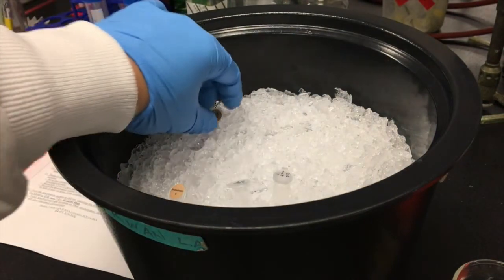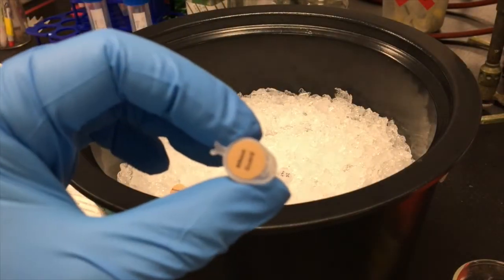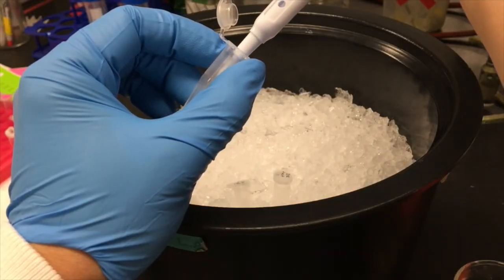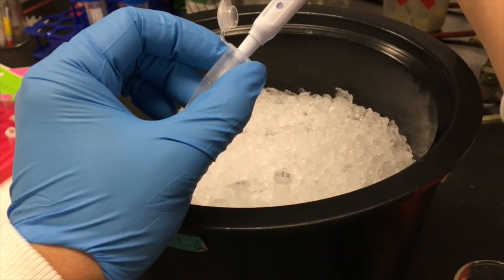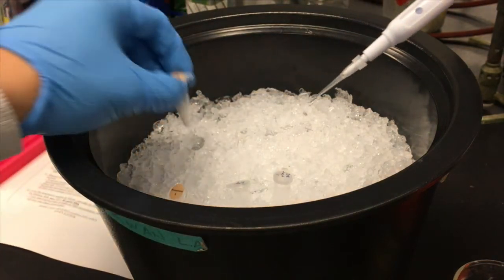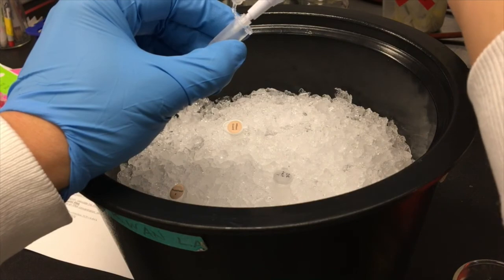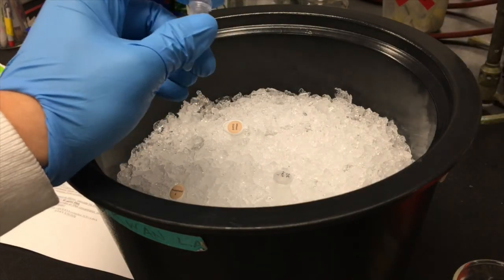It can be protected from degradation by adding a ribonuclease inhibitor called RiboGuard. On this sample of RNA, you will perform real-time RT-qPCR analysis. But before you do that, you'll need to measure the quantity and quality of the RNA in subsequent steps that you will do yourself.